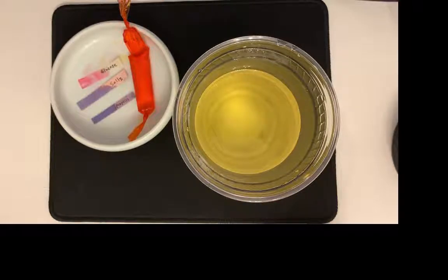I'm not sure if all of them moved into the dialysate, so here you can put yes or no, that's okay. But we definitely know that the glucose moved into the dialysate, the salts moved into the dialysate, but the proteins did not. The proteins stayed in the blood. So go ahead and answer the yes, no on this data table.